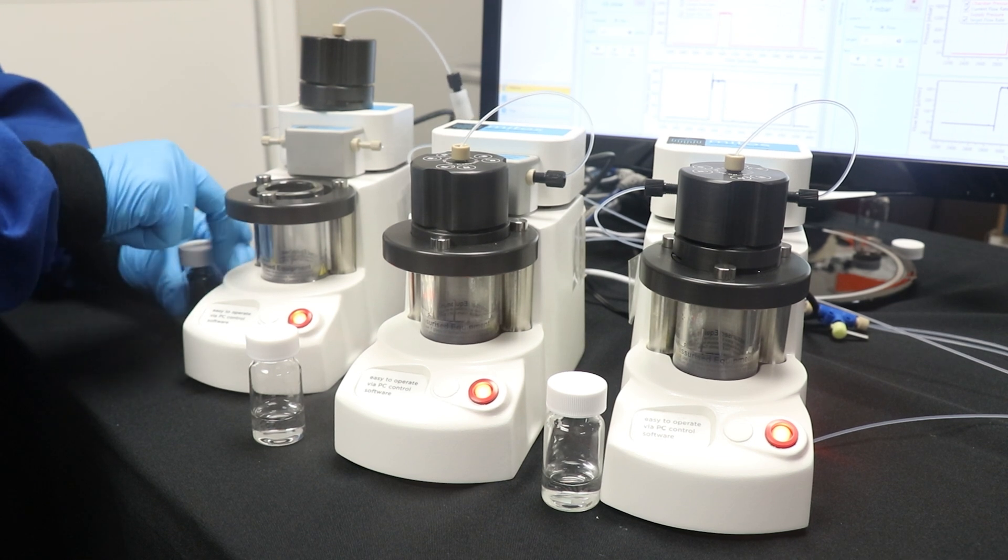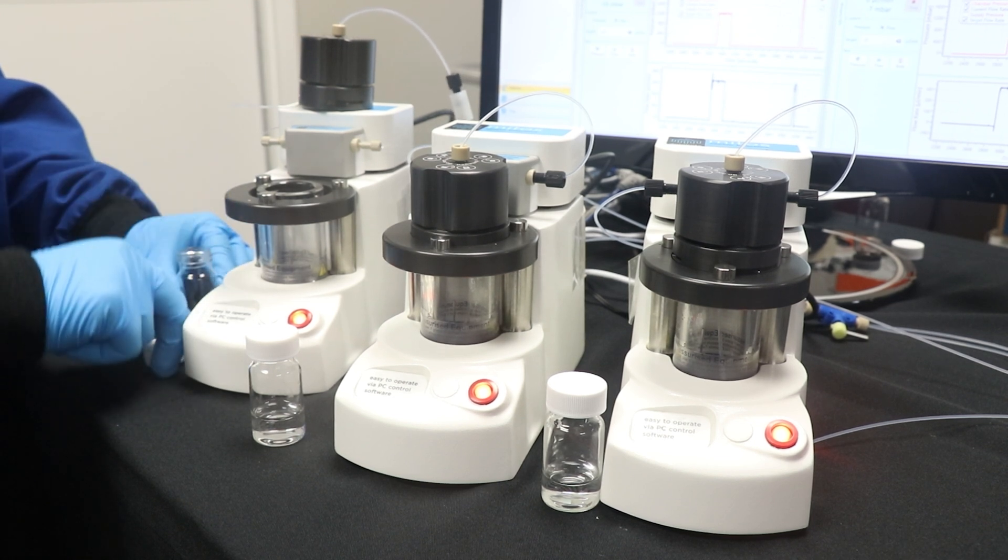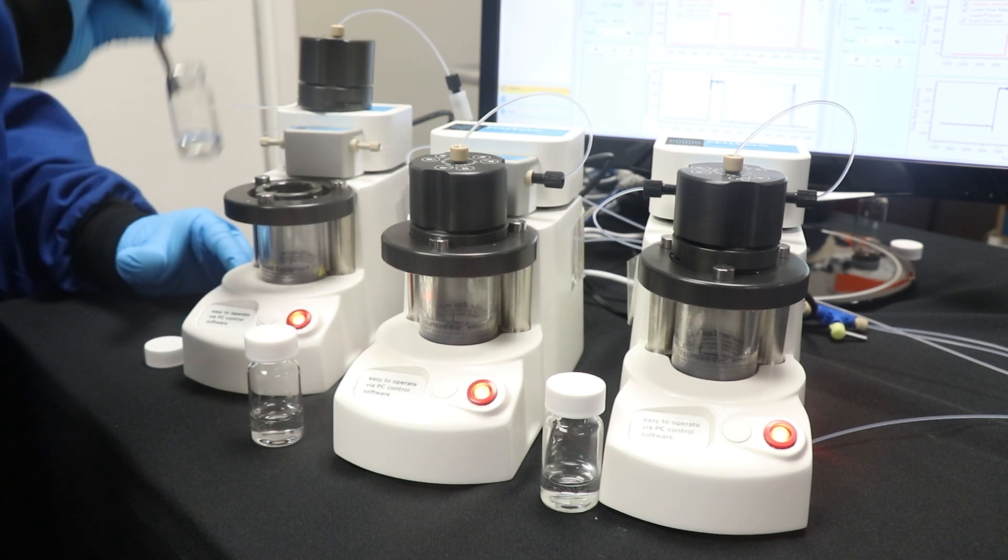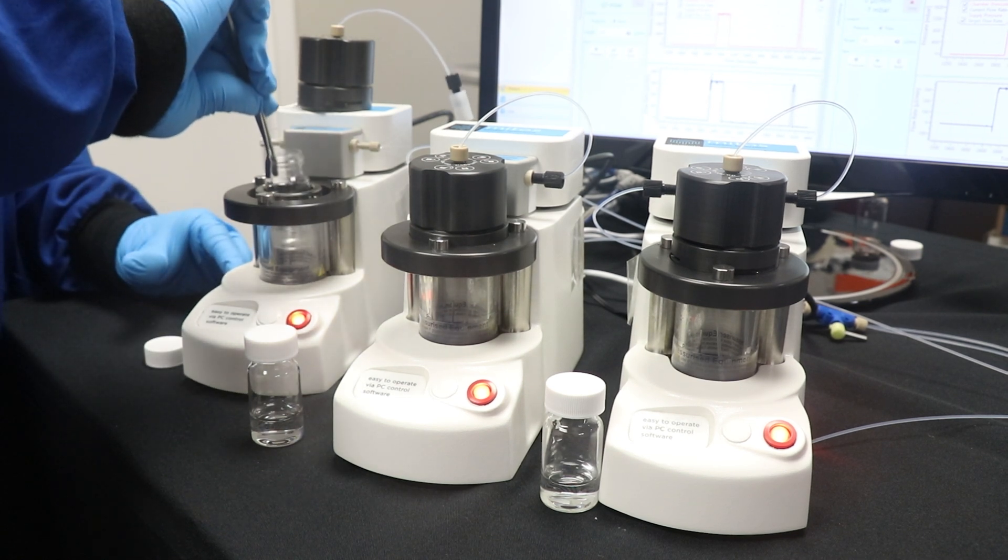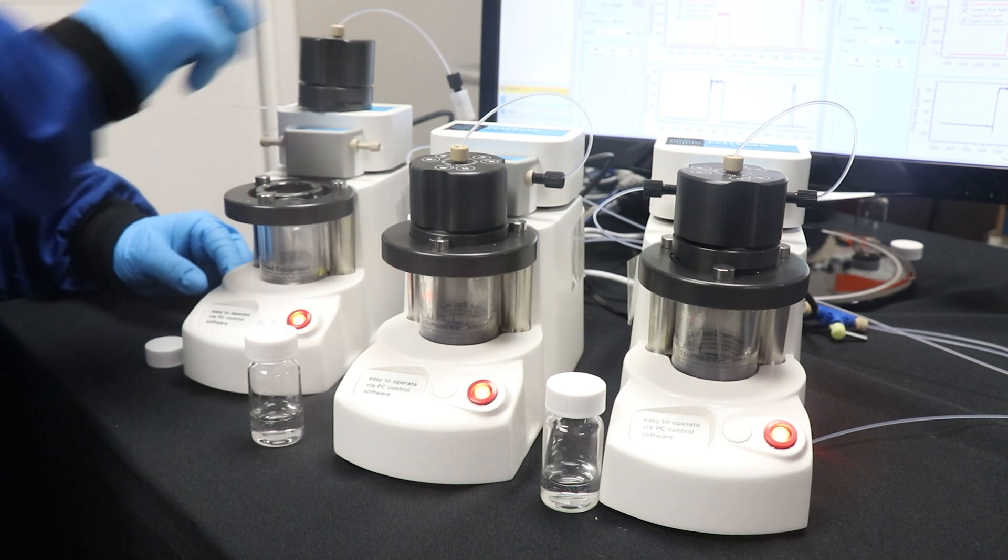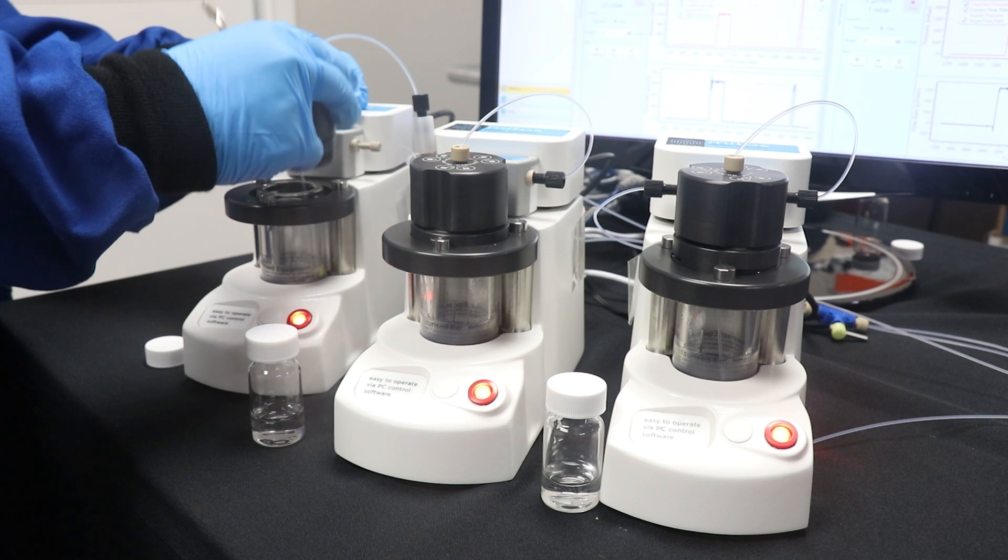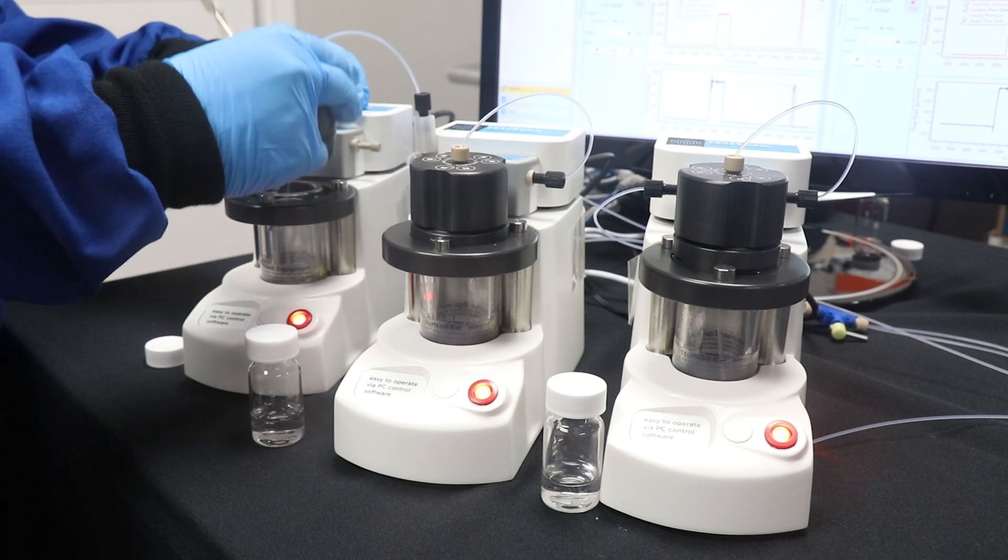First, we are going to load the solutions into our chambers. Here we have the organic solution. It contains lipids dissolved in ethanol at about 50 milligrams per milliliter. Common formulation parameters to evaluate include lipid composition and concentration, as well as solvent system.